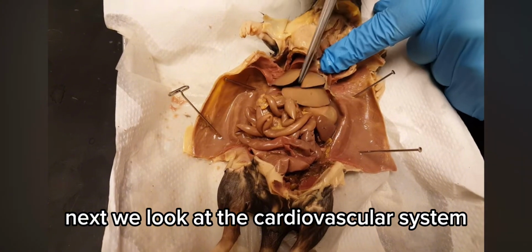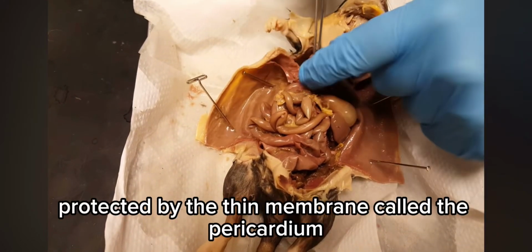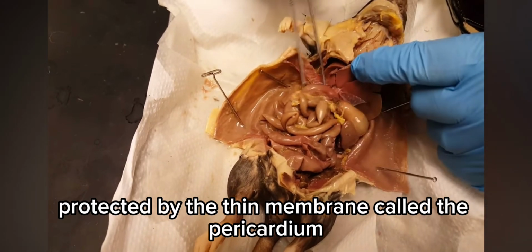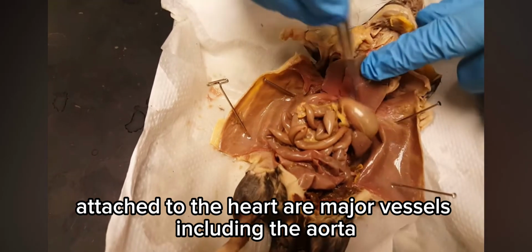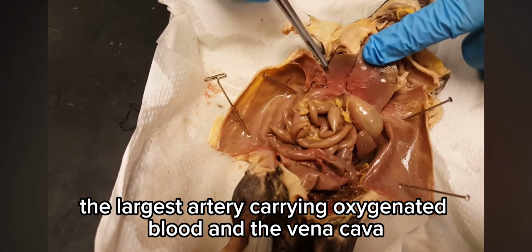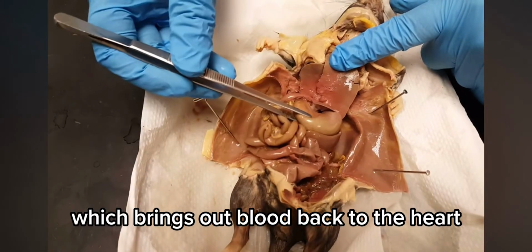Next, we look at the cardiovascular system. At the center of the thorax is the heart, protected by a thin membrane called the pericardium. Attached to the heart are major vessels including the aorta, the largest artery carrying oxygenated blood, and the vena cava, which brings blood back to the heart.